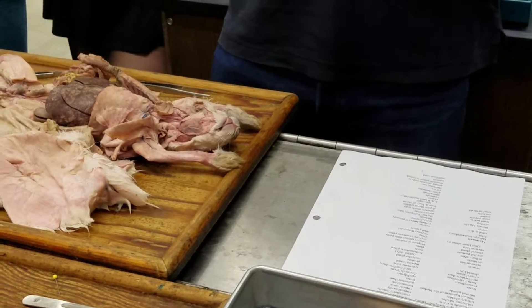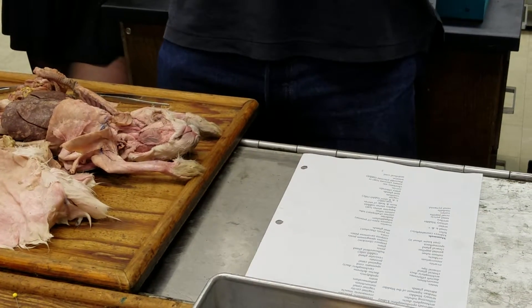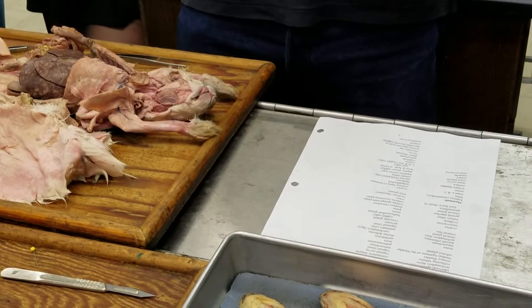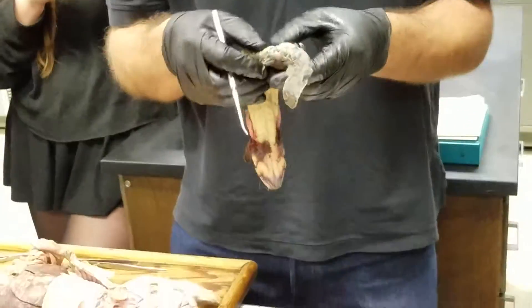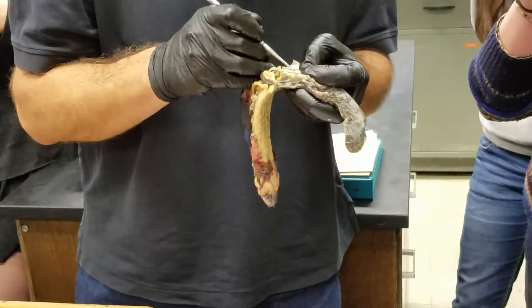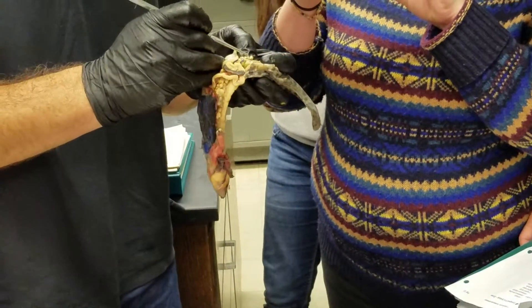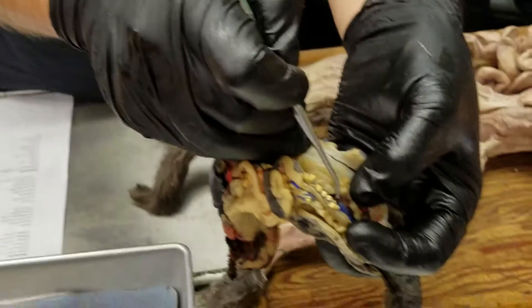The adrenal glands were something you're supposed to look for. The adrenal glands are not compact structures in Necturus; instead they're tissue on the surface of the kidney. If you look at the kidney and it was injected well, you'll sometimes see little spots of injection on the surface of the kidney — that's the adrenal tissue, which has a really good blood supply, appearing as little dots of blue or red. It's not that impressive, but nonetheless.